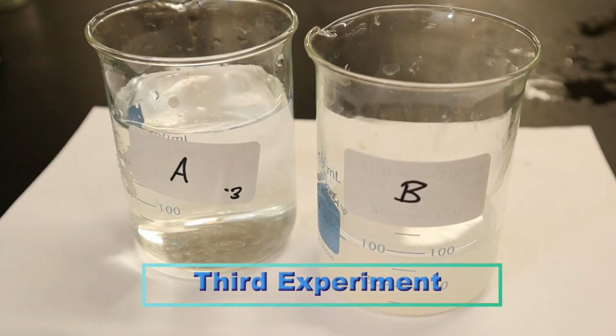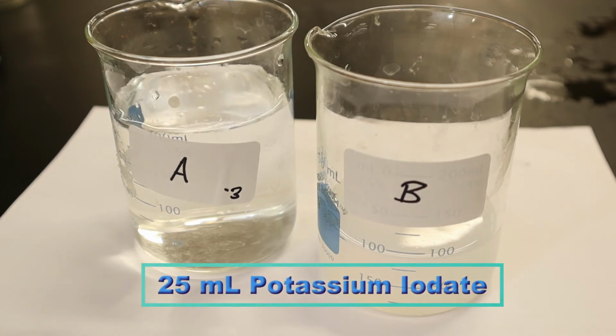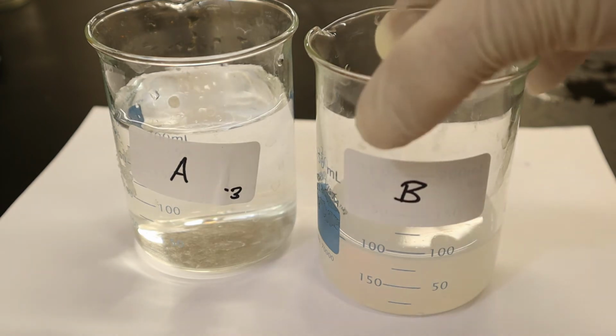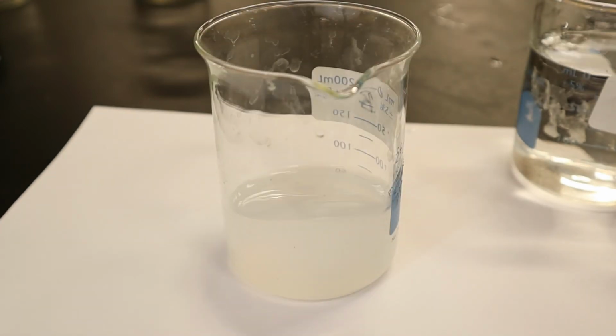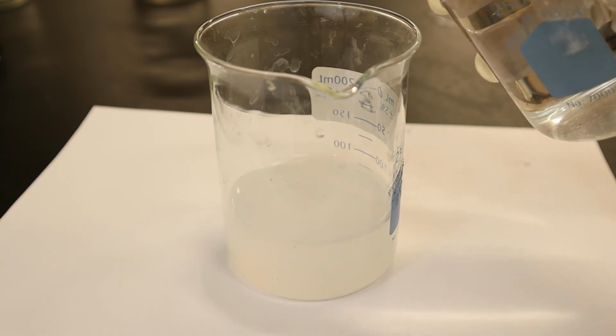Now we're going to mix the third solution. Remember, the third solution now has 25 milliliters of potassium iodate. So what do you think is going to happen? Is it going to speed up the reaction or is it going to slow it down? Think about it. Here we go. Hold on to your hats.